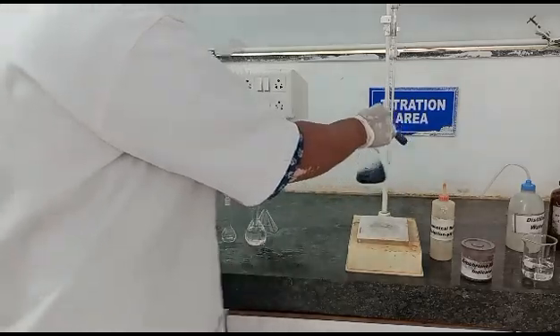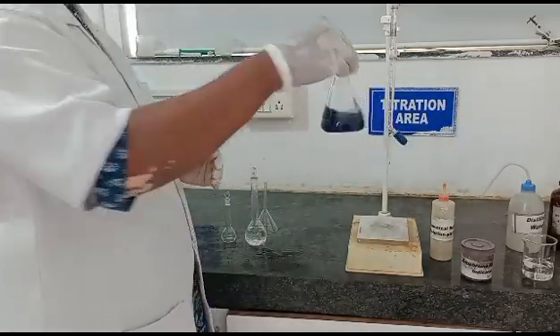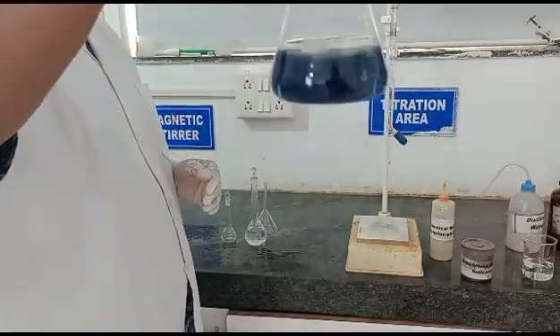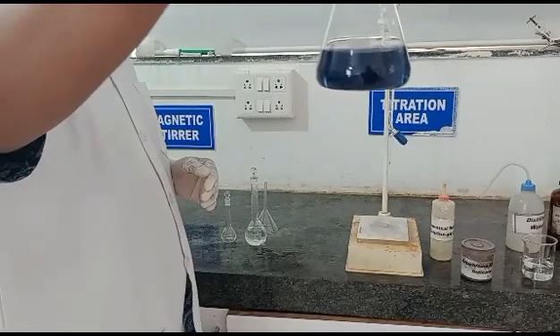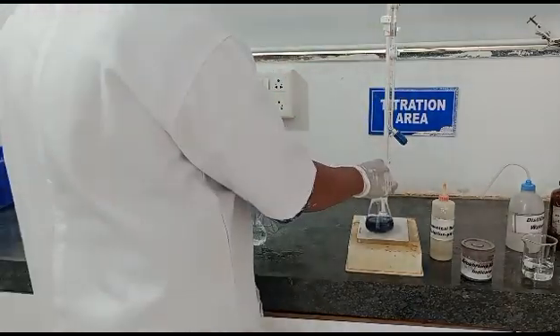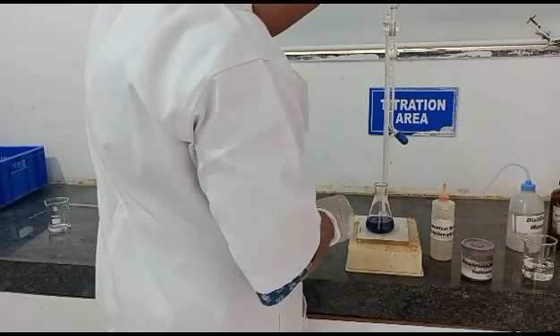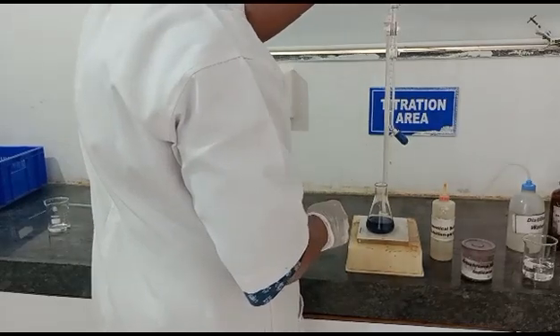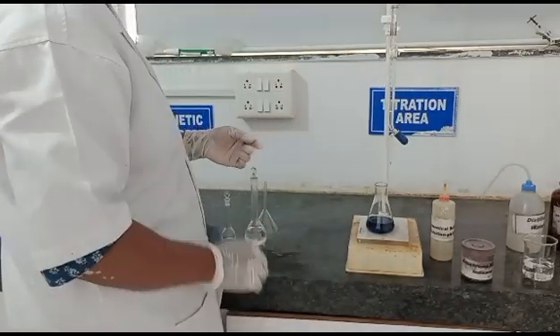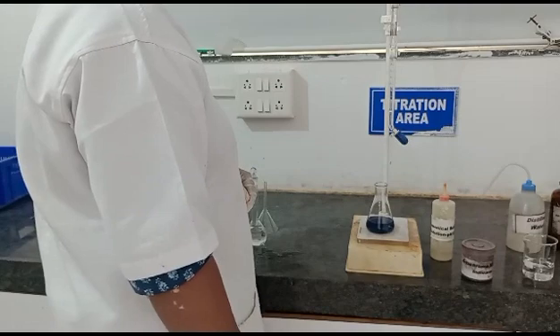Now this is the end point of our titration, that is the pure blue color. We will note down this burette reading for the standardization calculation. This is the procedure for standardization.